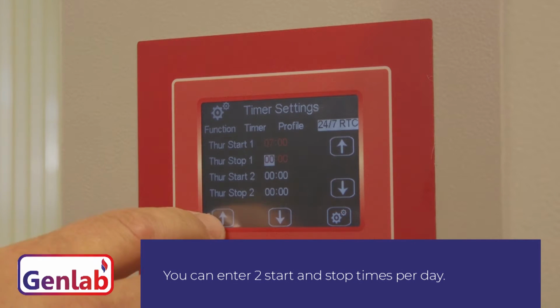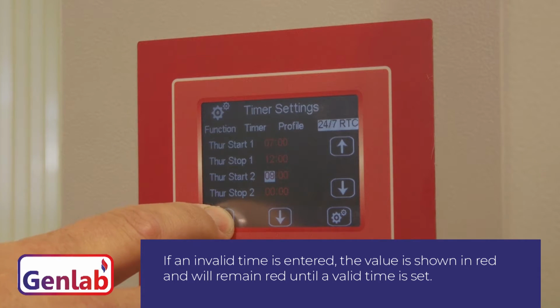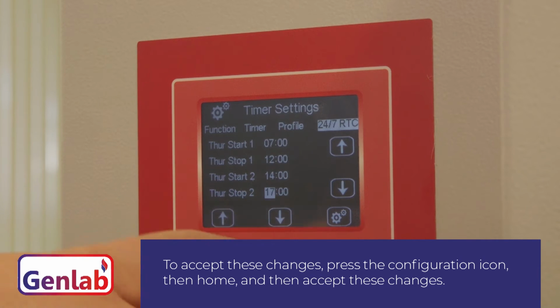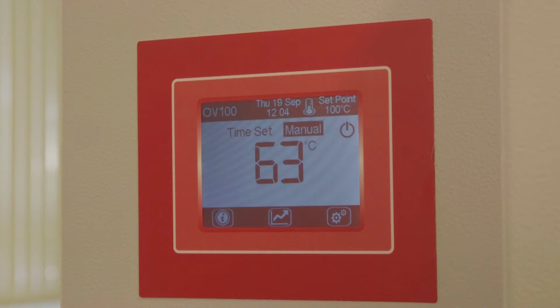If an invalid time is entered, the value is shown in red and will remain red until a valid time is set. Enter a start and stop time for each day you want the oven to run. To accept these changes, press the configuration icon, then Home, and accept these changes. You will now notice on the run screen you have a time clock/manual mode.